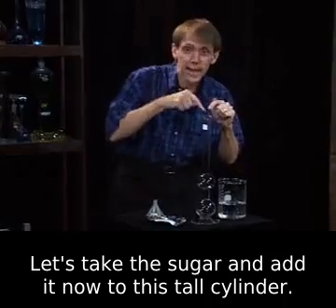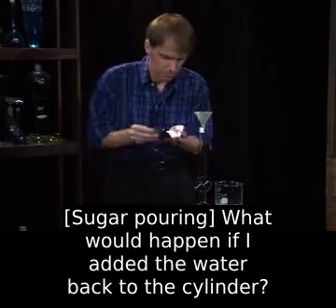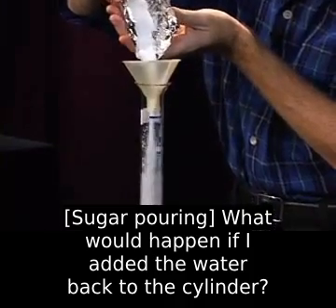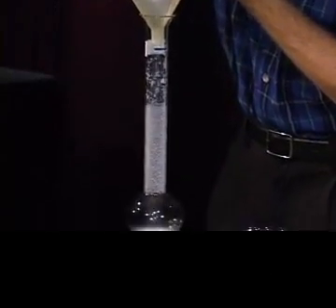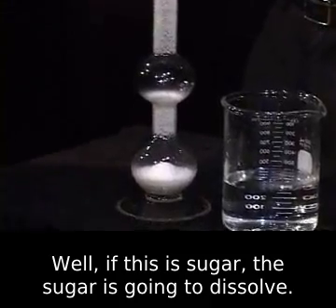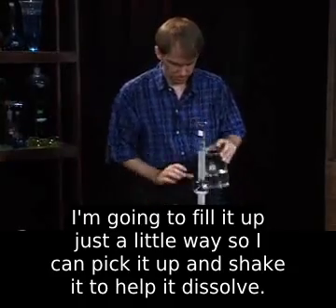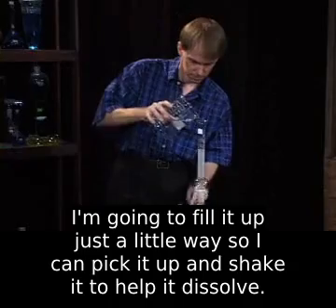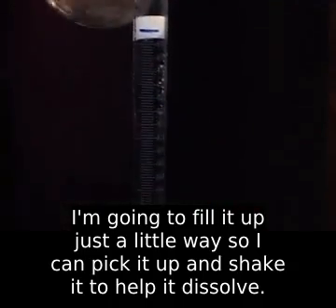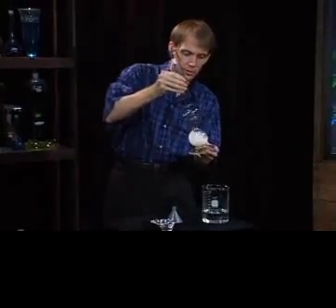Let's take the sugar and add it now to this tall cylinder. What would happen if I added the water back to the cylinder? Well, if this is sugar, the sugar is going to dissolve. I'm going to fill it up just a little way so I can pick it up and shake it to help it dissolve.